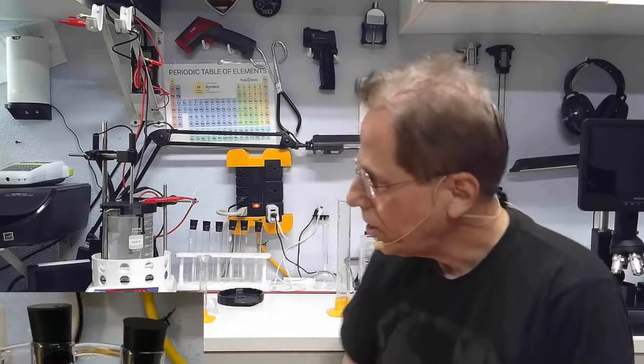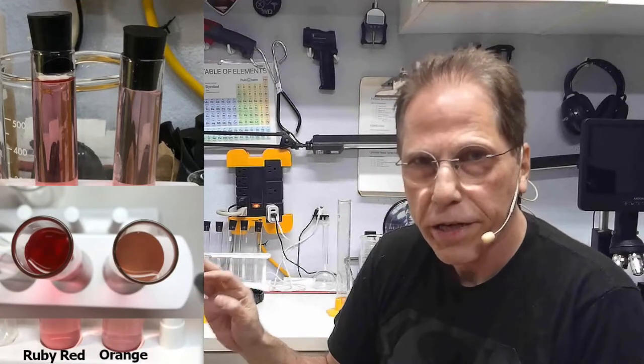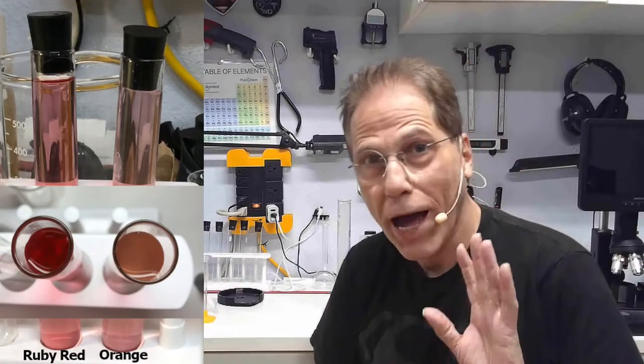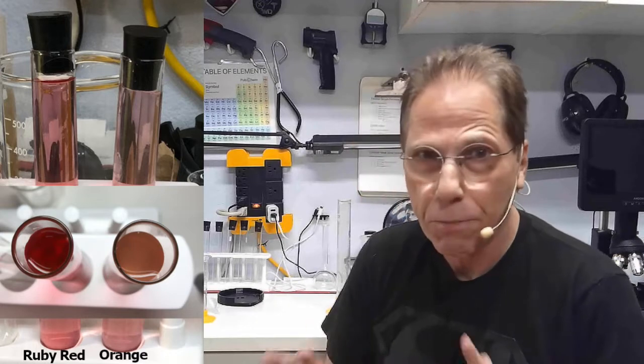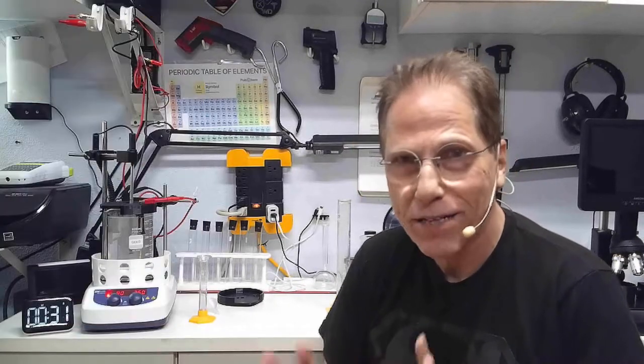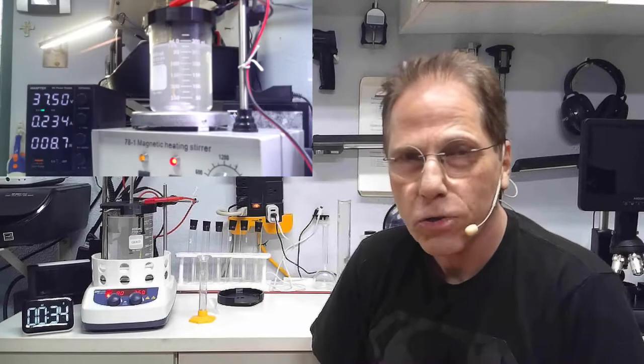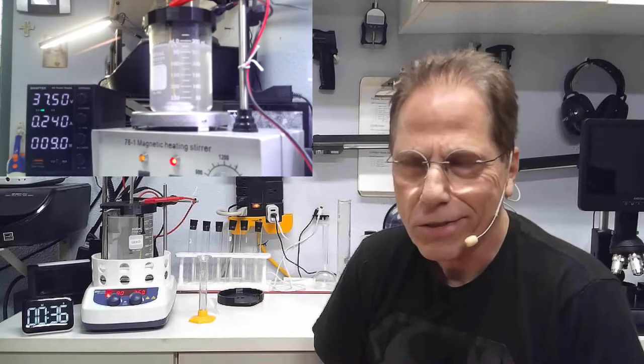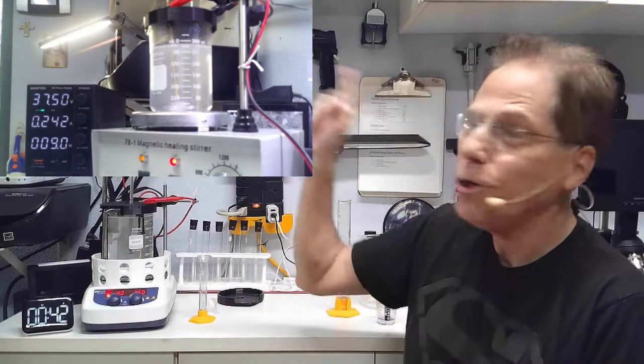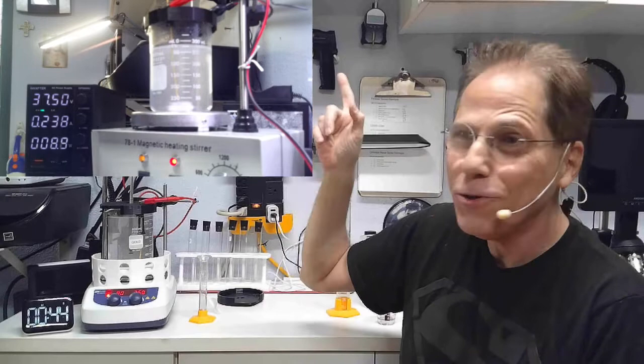The danger that you have here is what I call colloidal gold orange. If you overcook colloidal gold, it will go orange. I have a video showing this. I didn't plan to make this video. Back in the early days when I was doing colloidal gold, I forgot and left the process. I happened to put a time-lapse camera on it, so I'm going to show you a video of what happens if you let your gold go too far. You will see it starts out very nice, becoming a ruby red, and quickly degenerates into colloidal orange.